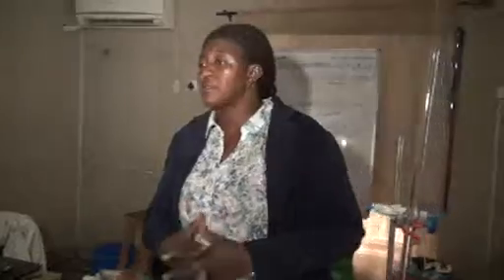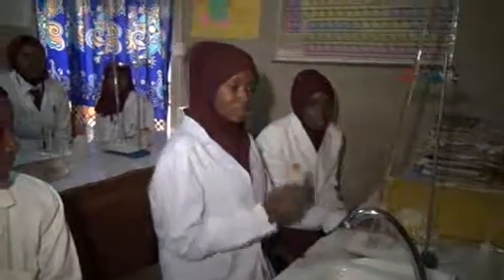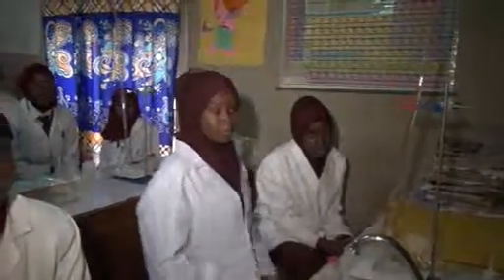Now we have ended this titration for today, but I want us to still remind ourselves of the precautions you took while you were conducting the practicals. So who will remind us? Yes, Miligoma? You should not use more than 2 or 3 drops of the methyl orange, and you should be consistent with the drops you are using. Thank you. Clap for her.